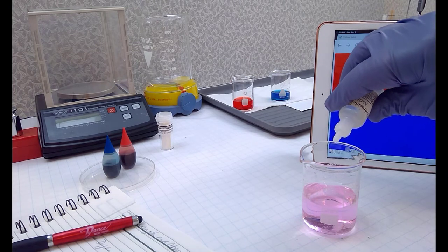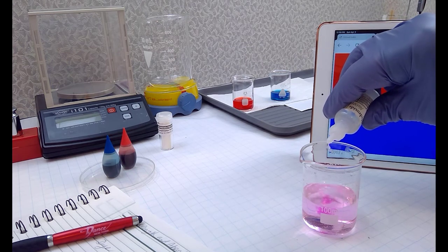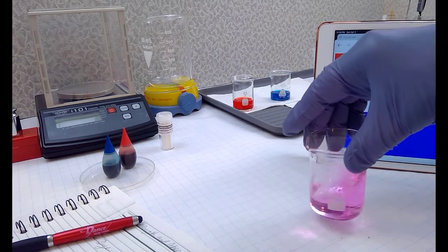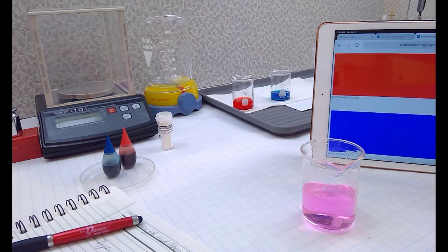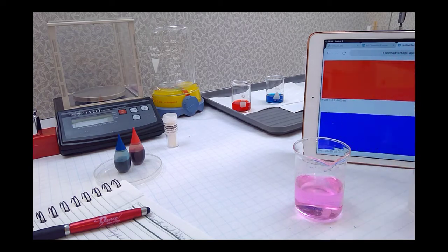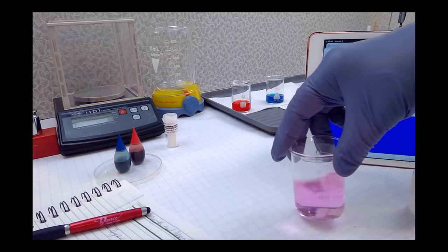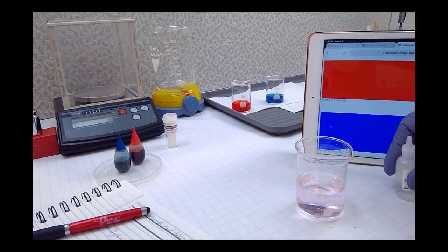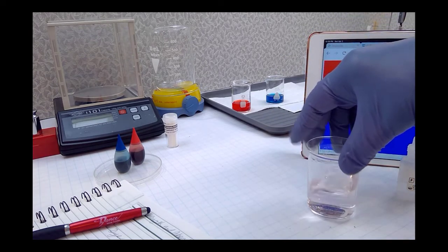Here's some hydrochloric acid, about the same number of drops. Oh, no, that was sodium hydroxide. Error. Read the containers twice, and as you can see, it's become an even deeper magenta. Next, I'm going to neutralize that basic solution, adding equimolar amounts of hydrochloric acid. I'm going to need about, my guess is, 7 drops. We'll mix the solution up, add a little bit more acid, and voila, there it is, back to clear.